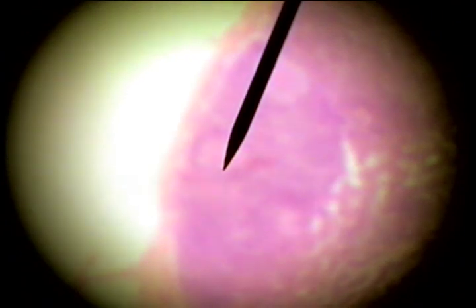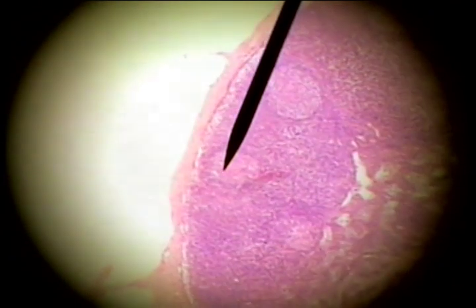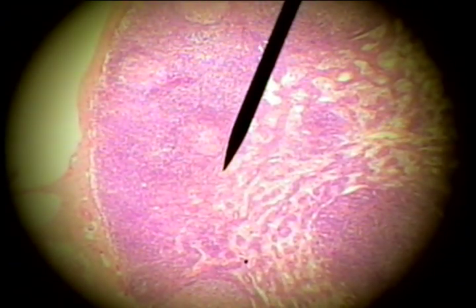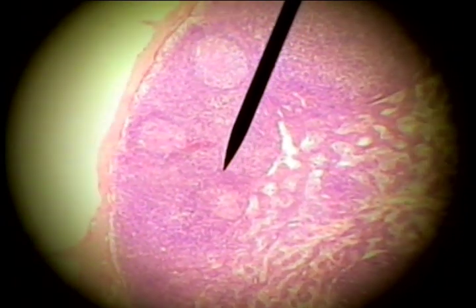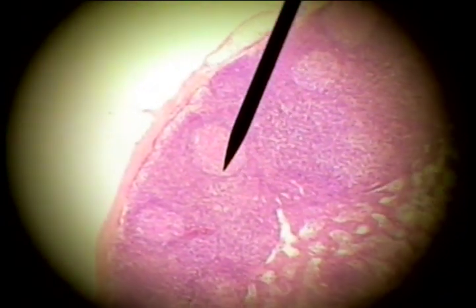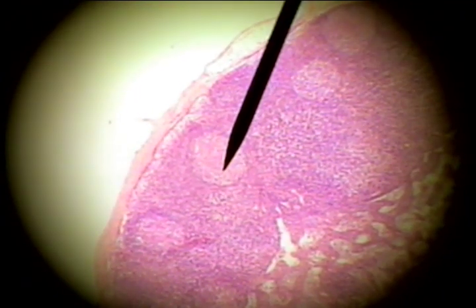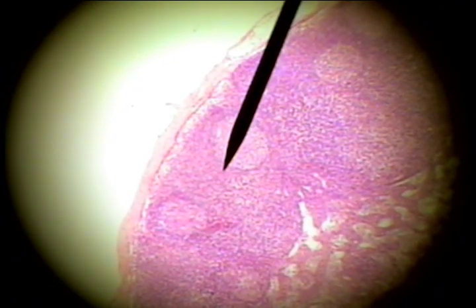The outer portion of the lymph node is called the cortex, from this area to this area. In the cortex, we find these spherical structures called the lymph nodules. The nodule has a lighter germinal center and a darker corona.